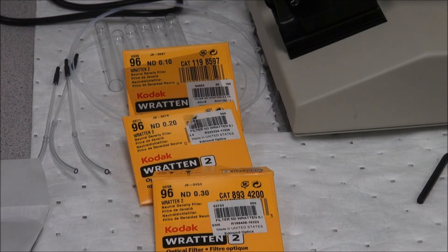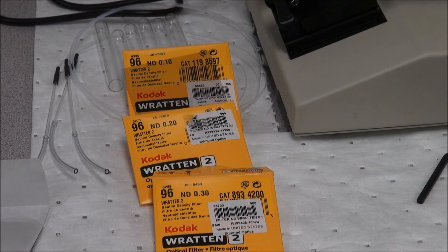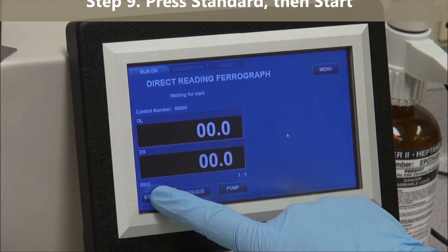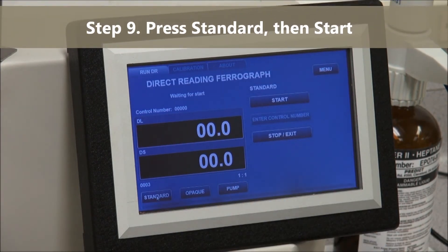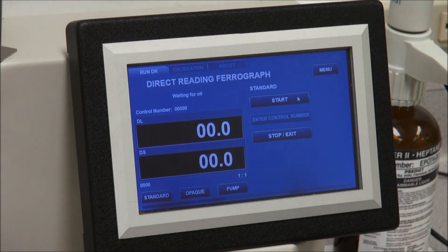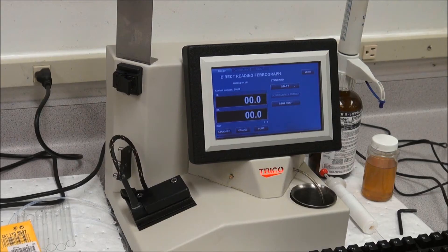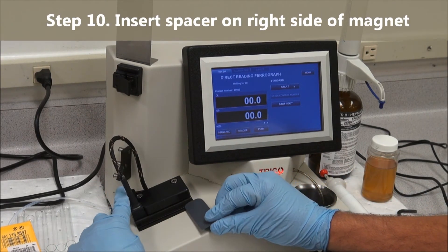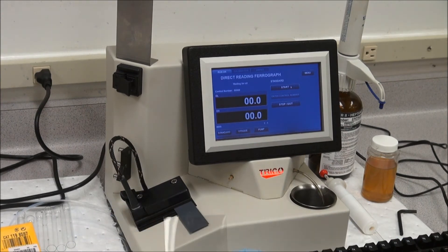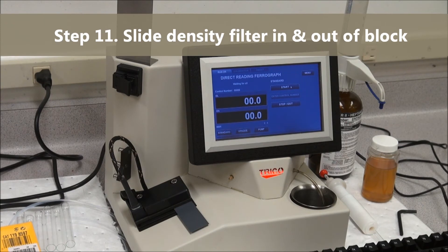We run a standard test with each one of these, assuring that they fall within the DL and the DS range stated in the instruction manual. To run a standard test, hit the standard button in the lower left hand corner. Hit the start button to start the test. Waiting for oil will come up in the center of the screen. Insert the spacer on the right hand side of the magnetic block.